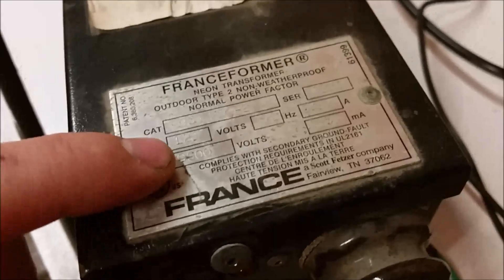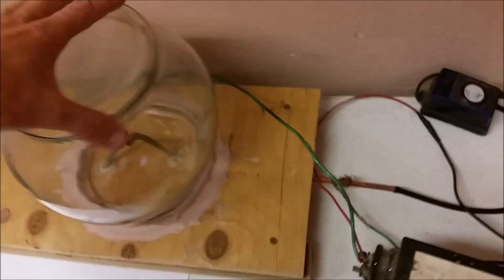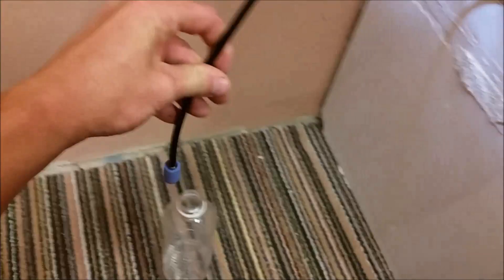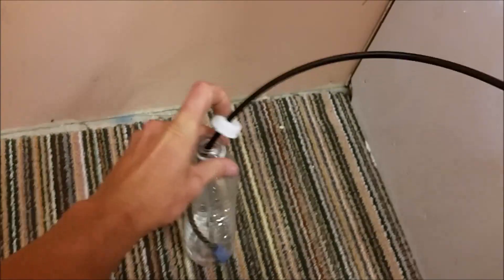I'm going to be simulating lightning with this 9,000 volt transformer, which I got from the DI — I assume it was originally for neon lights or something — and I'm going to be running the electric arc through this fish tank bowl. On the underside I've got some copper tubing running in, and the arc will jump between these two tubes. Through the tubes I'll be running air using this little fish tank bubbler, and that air reacted with the electricity will come down into my bottle of water here with this little bubbler stone, and hopefully I form some nitric acid.